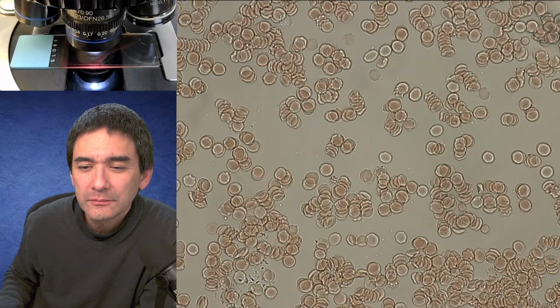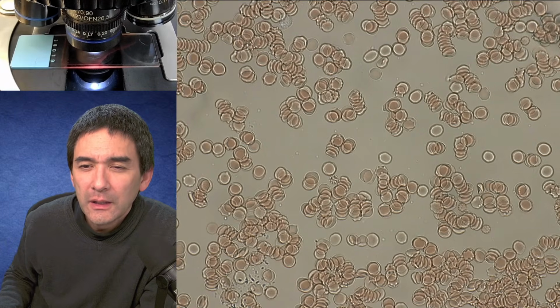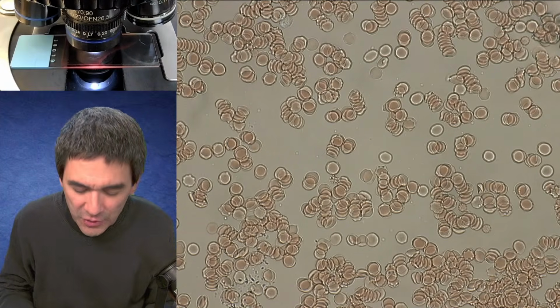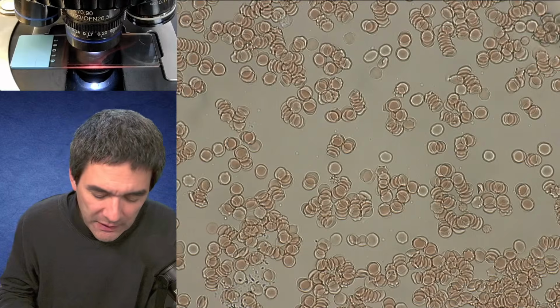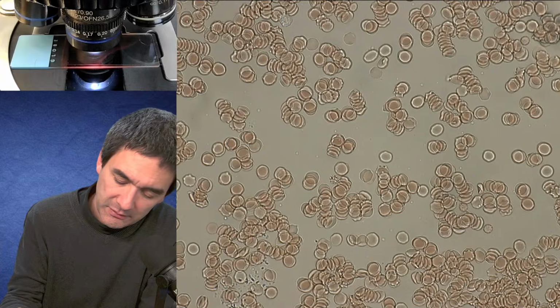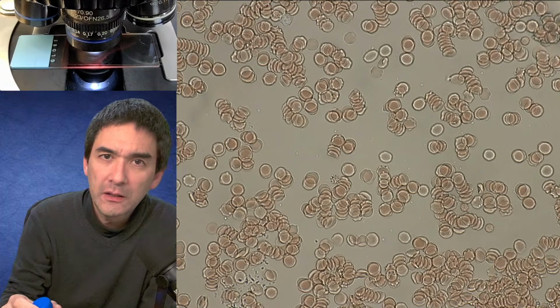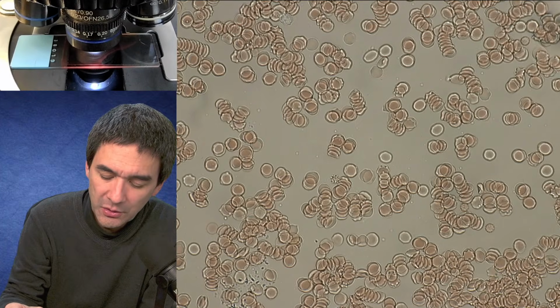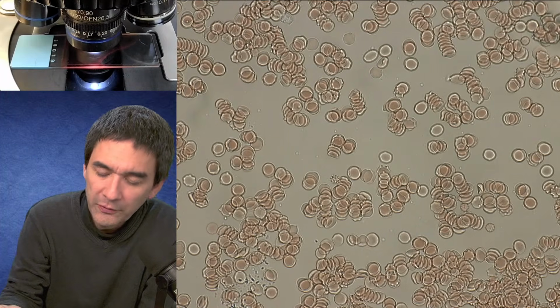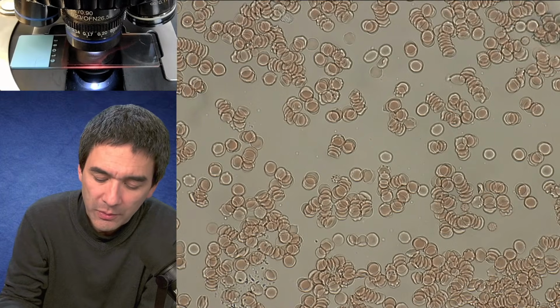So yeah, next comments down here, if I can only find them. Is 10% hydrogen peroxide strong enough for this? I can't buy strong here in Norway. I think it is. You just have to wait longer. What's really important is that if it starts foaming, then it's a good sign. And now it's really foaming. I don't know if you're able to see it. You should heat it up over a water bath. And if it's used up, you just pour it off and add some fresh hydrogen peroxide. So it's more a question of timing then.